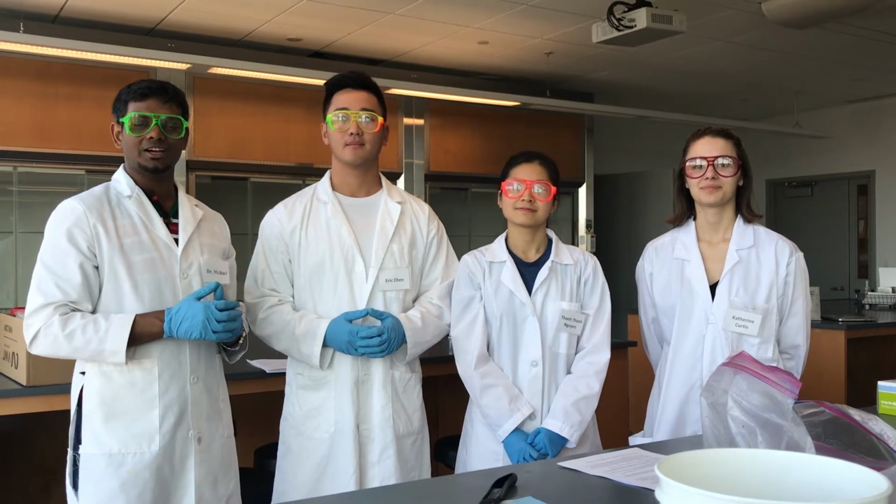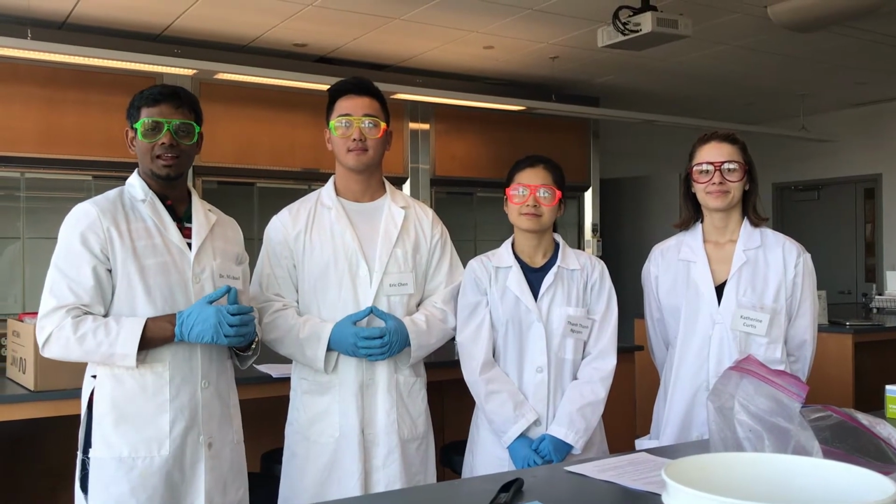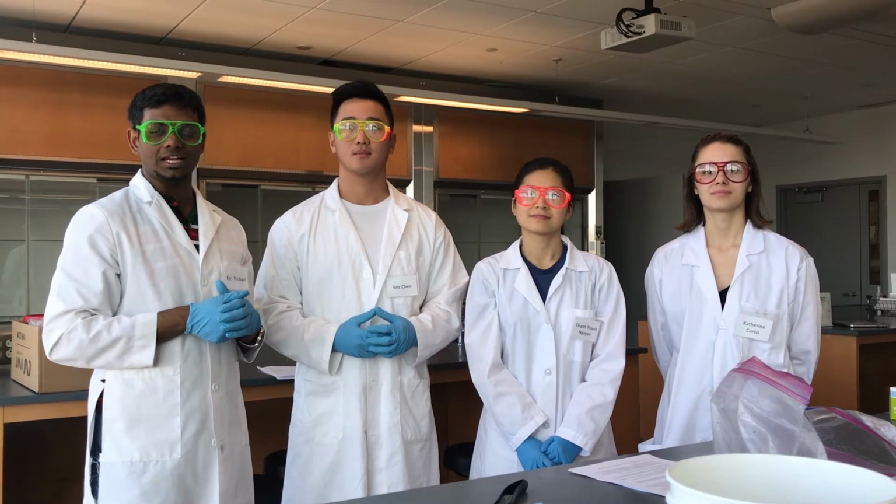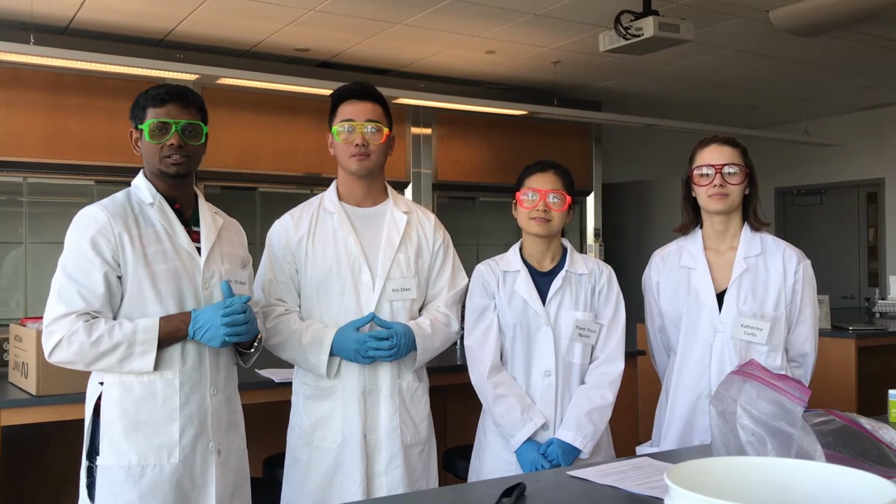Hello everyone, welcome to our dissection of the sheep kidney, and as mentioned previously, we'll only be talking about the details which are relevant for the anatomy physiology laboratory course NS 3420.